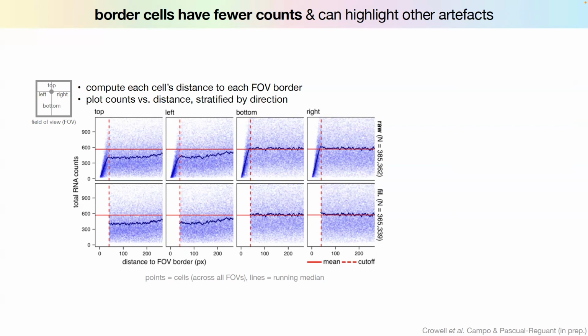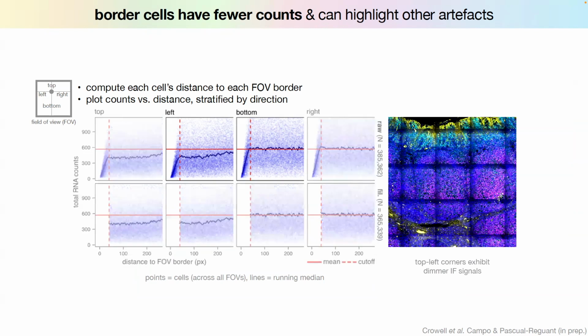And another thing that you might see is that this sort of looks the same as this, but those are different. I call it a corner effect. There seems to be a difference between the top left and the bottom right. And what you can see here is that the DAPI and the CD45 staining was a bit dimmer in one of the corners. And you could see that at the count level. That makes sense because the segmentation relies on the staining. And if the staining is really bad on one side compared to the other, you will get these kinds of artifacts. But this machine has been replaced, so I wouldn't say that's a typical thing.